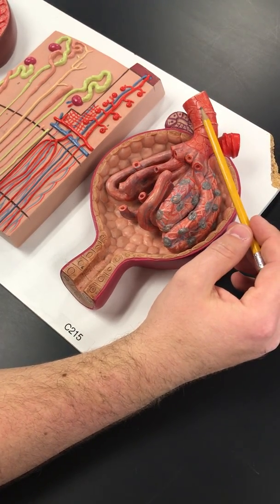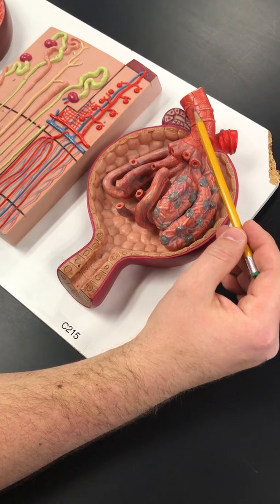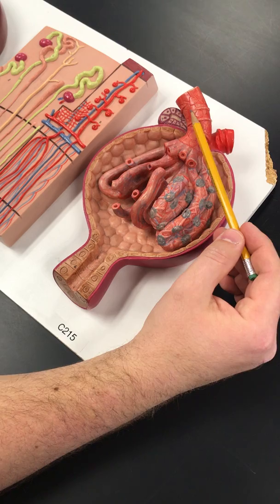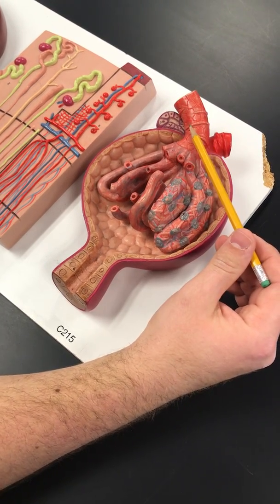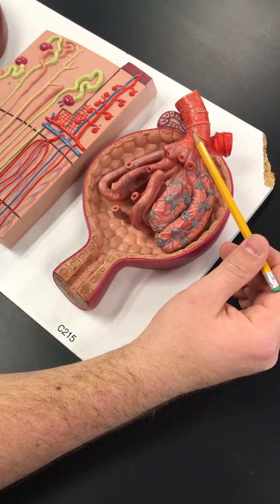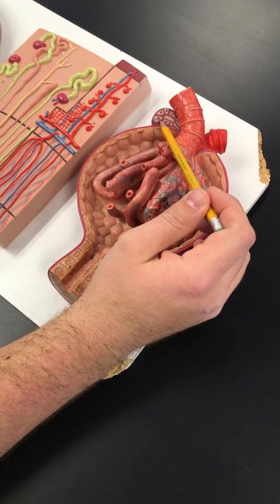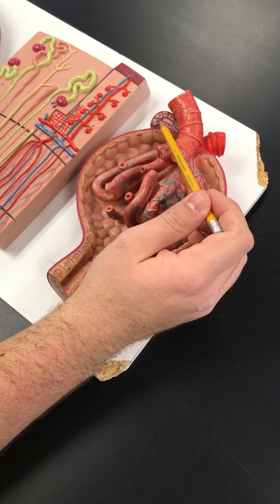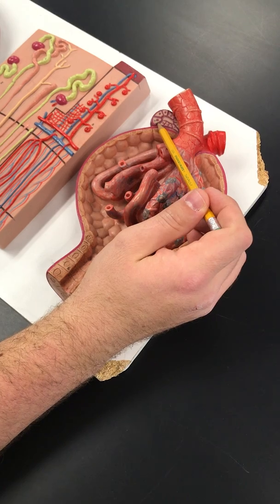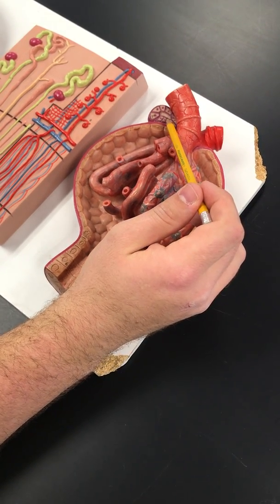It looks like cracked desert floor here. These hexagons, these cells are called granular cells of the afferent arteriole. That's part of something called the juxtaglomerular apparatus. So all this stuff is on your list. And then these cells that are present in this part of the distal convoluted tubule, these are called macula densa cells. So these are also part of that juxtaglomerular apparatus.